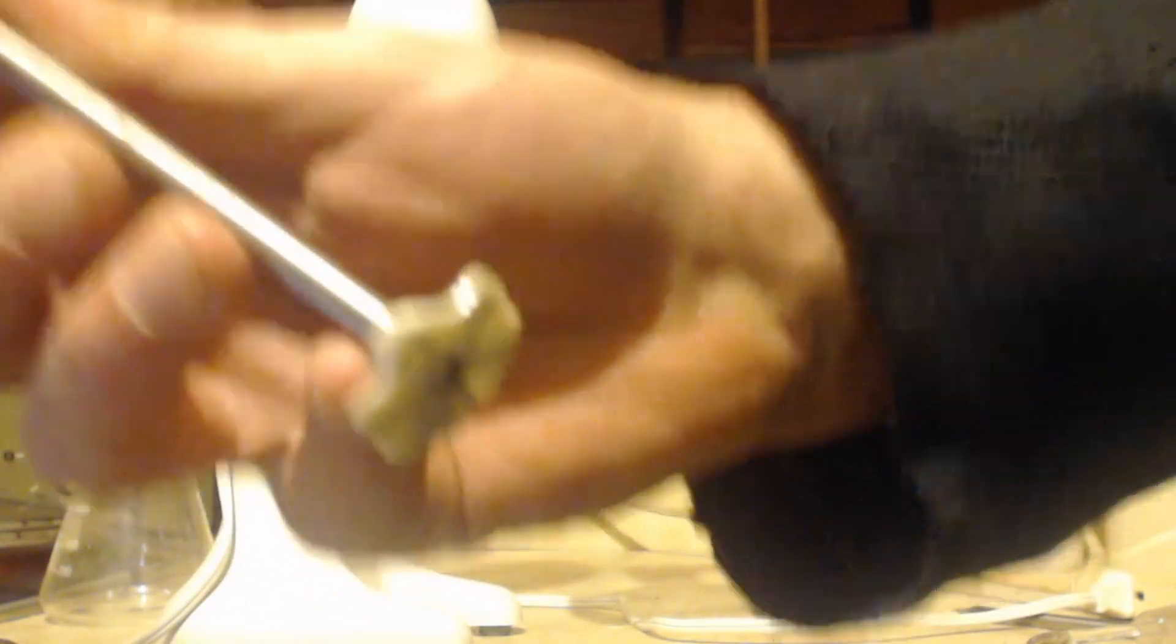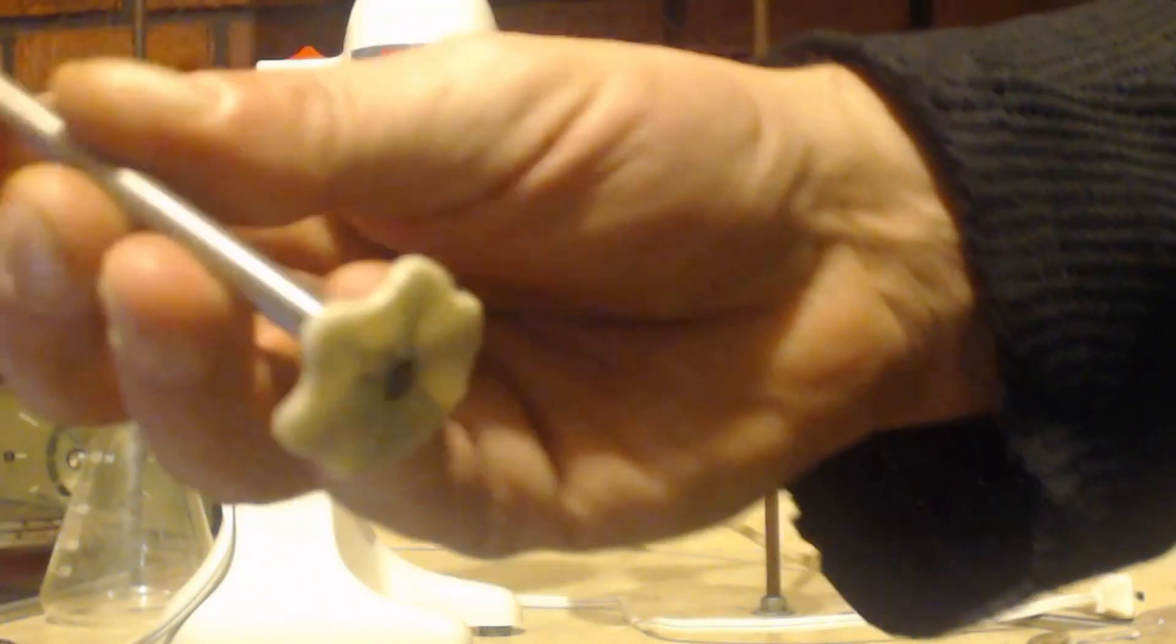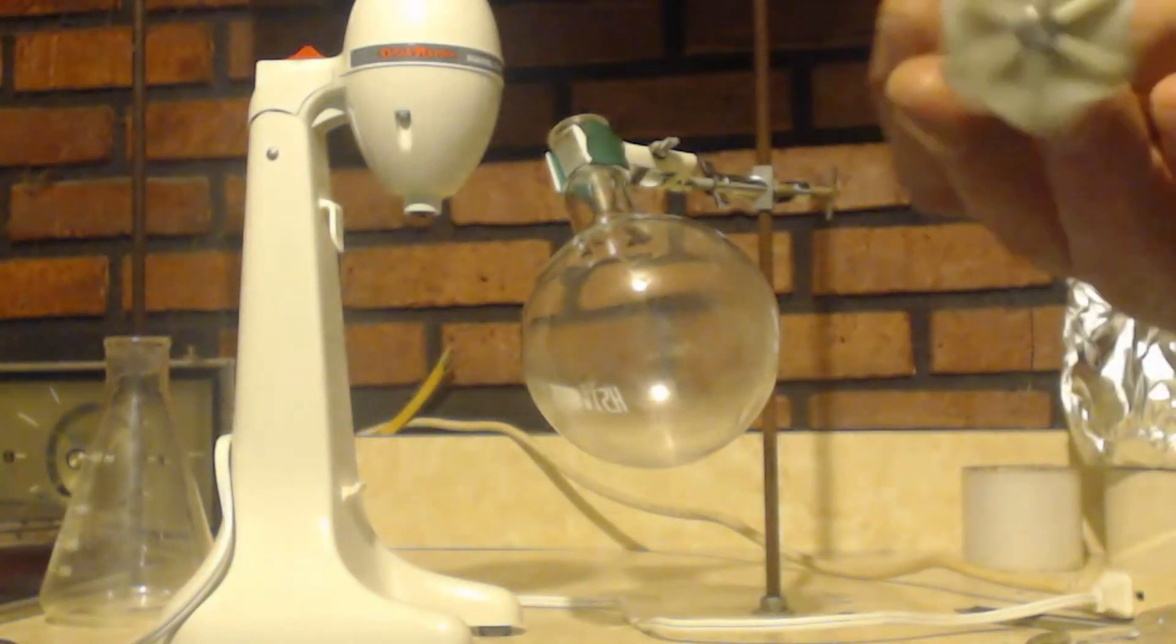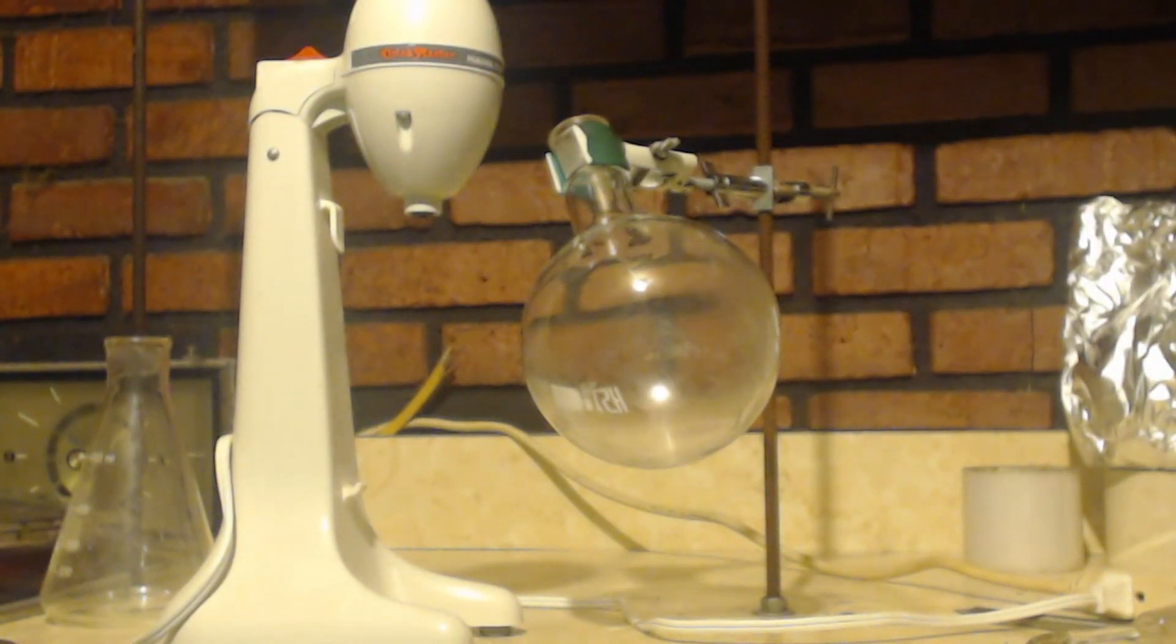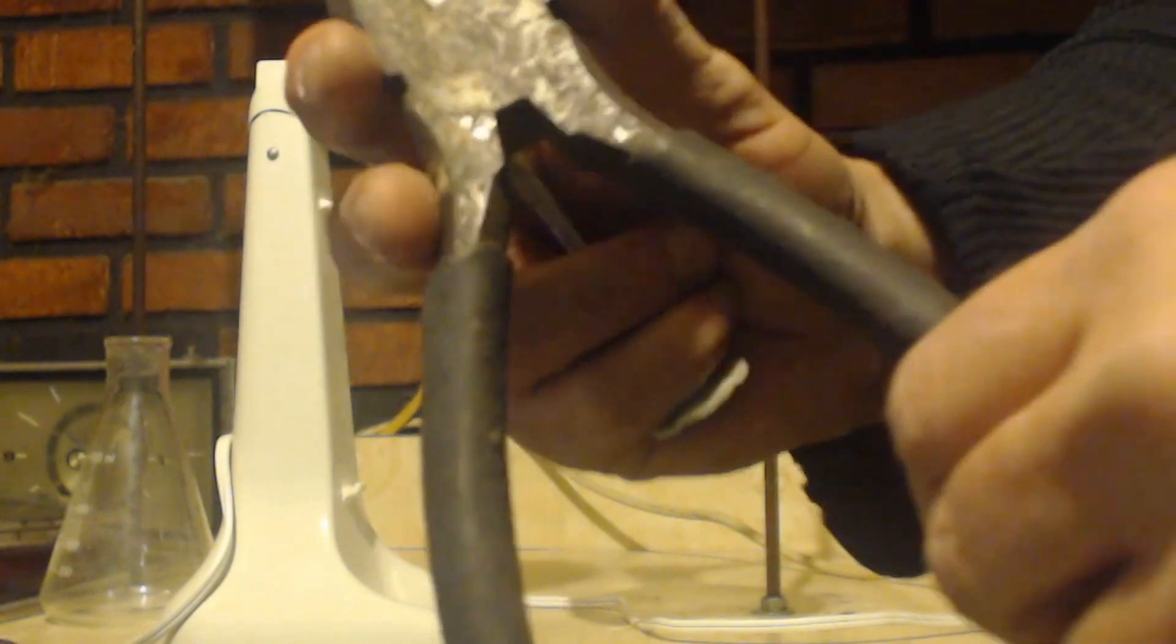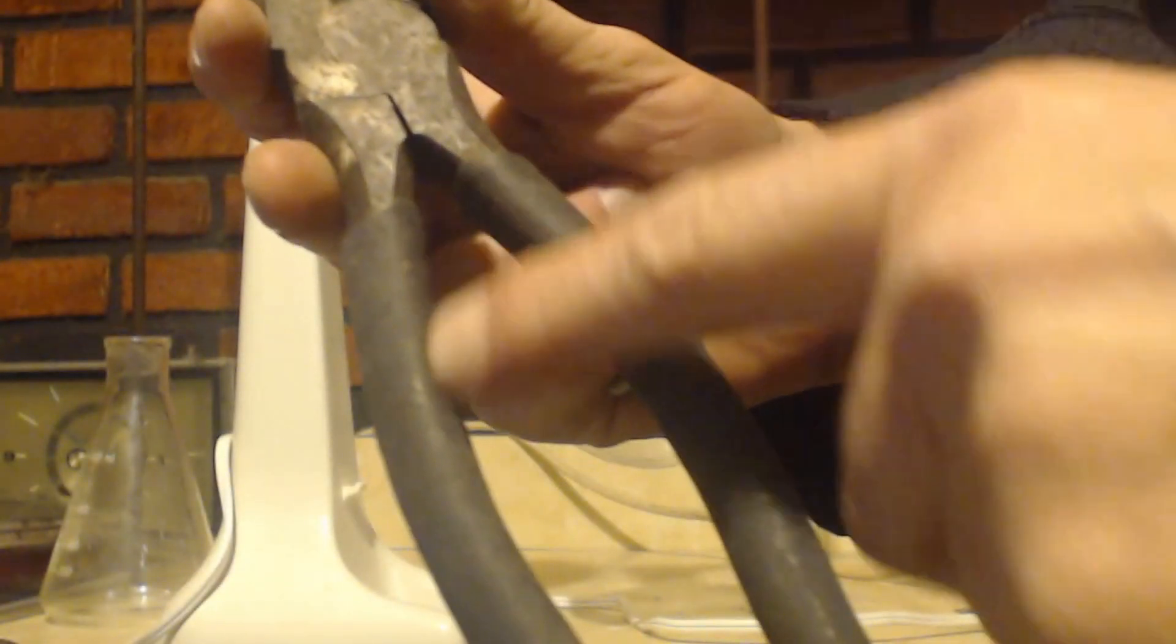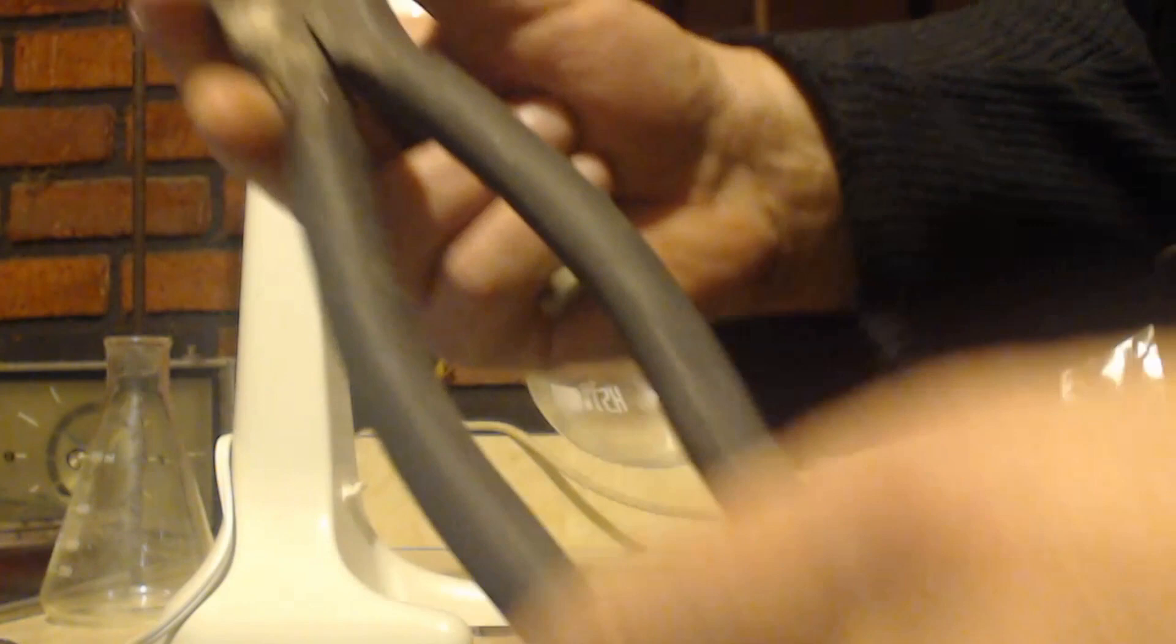Diethyl ether might dissolve it, DCM might dissolve it. The metal you have to worry about acids and maybe even bases that it's going to corrode it and react with it. But there is that something, I don't know if it's vinyl or PVC, it's a liquid you see on a tool.